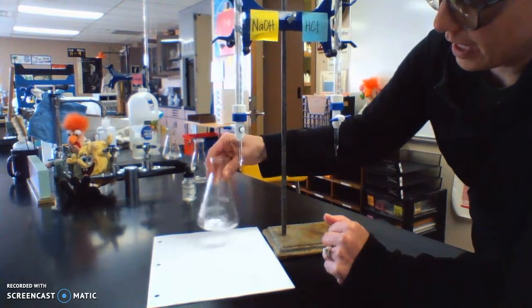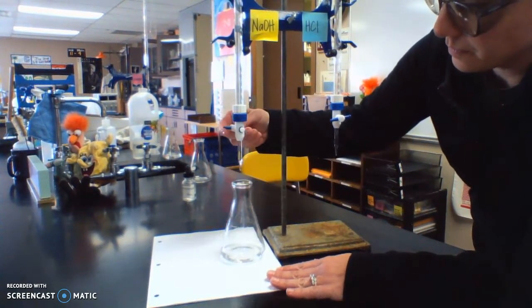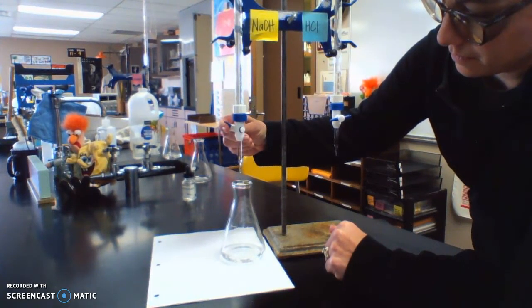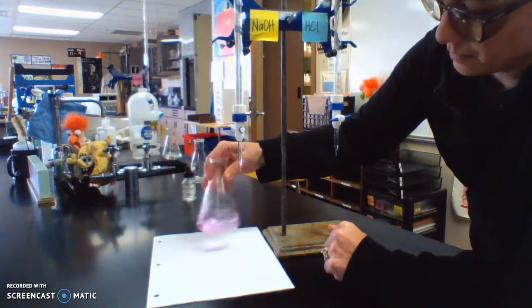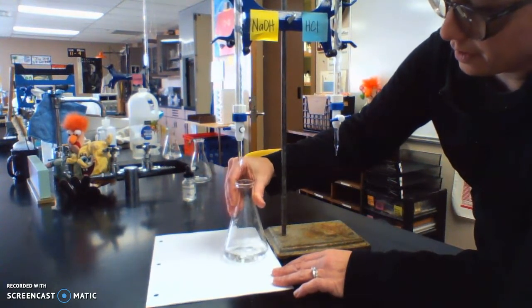There we go. Okay, I think we're about there. I'm going to add about one more drop. I think we'll call that good.